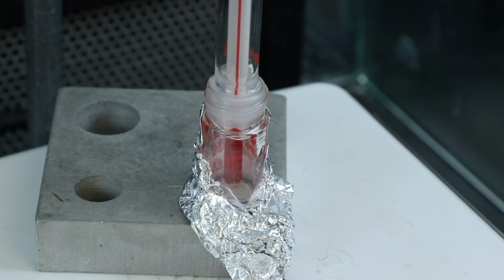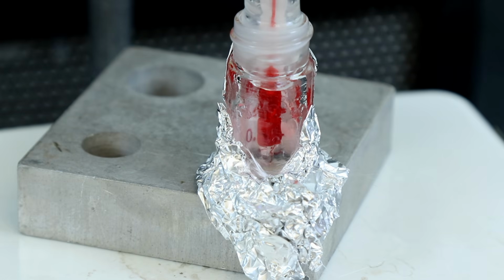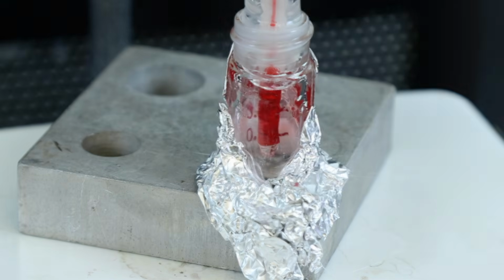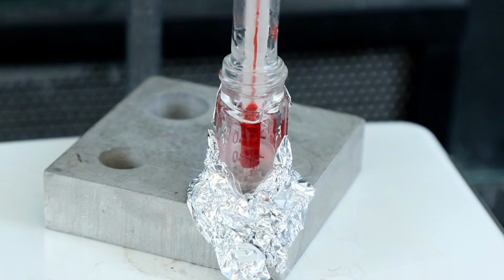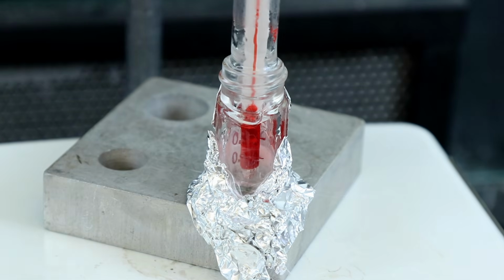So now I'm going to start heating things up, and we can see the temperature rising slowly as the conical vial begins to heat up. And we can actually start to see some condensation on the side of the glass, and eventually the ketone will start to bubble. But the temperature is still rising, so we're not going to measure the boiling point quite yet, until a good reflux is observed with condensation a few centimeters up the glassware.